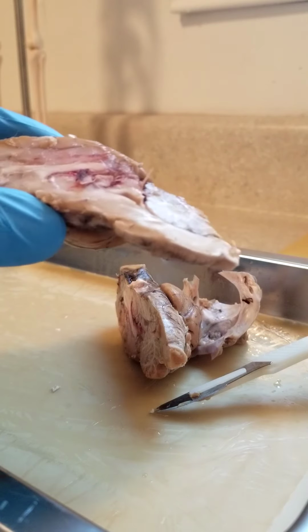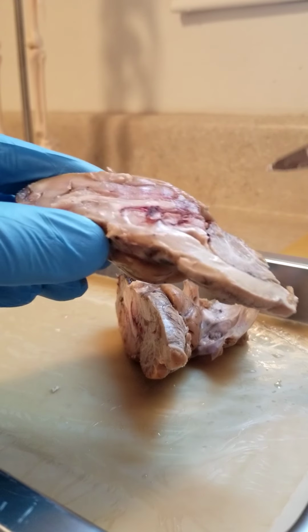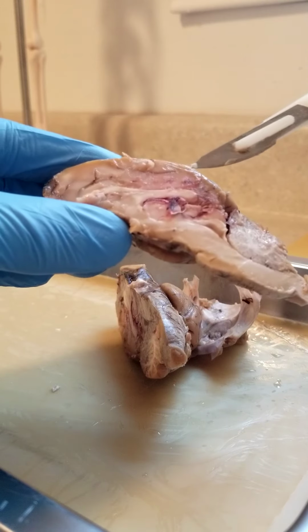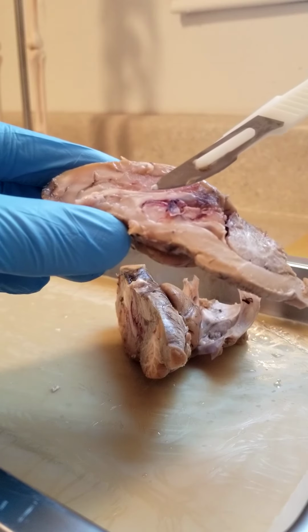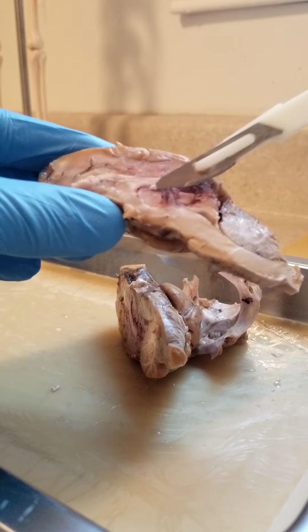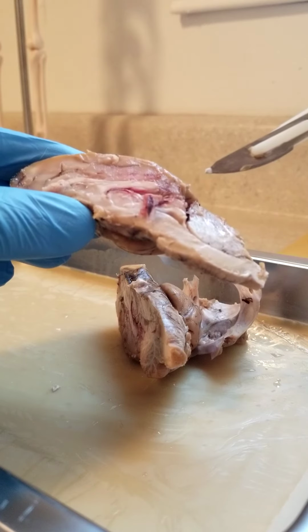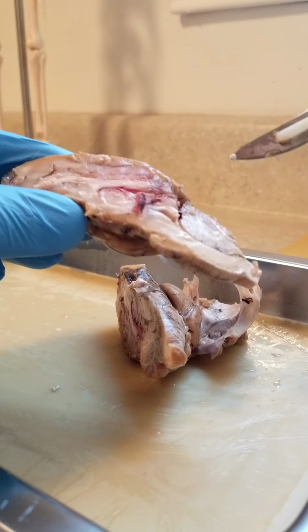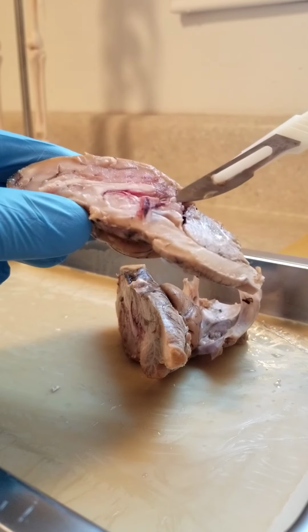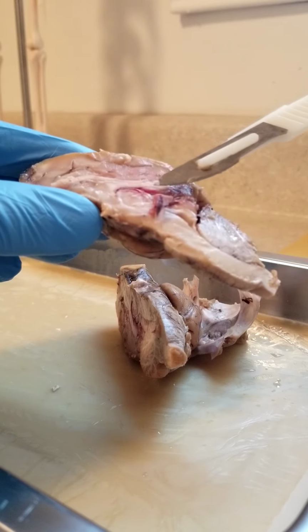Now changing views here to the mid-sagittal section is what we're discussing. The corpus callosum, right there, in the top middle. The thalamus, it's right there in the middle. Hypothalamus, hypo is going to be below that. Let's see here. A lateral ventricle right there. Septum pellucidum. Looking in that area right there.